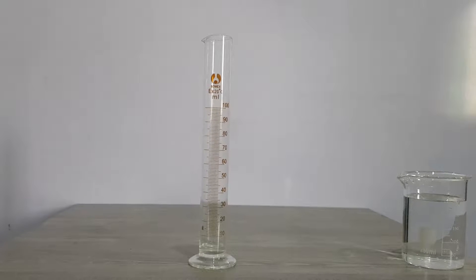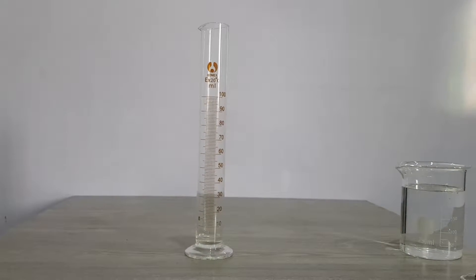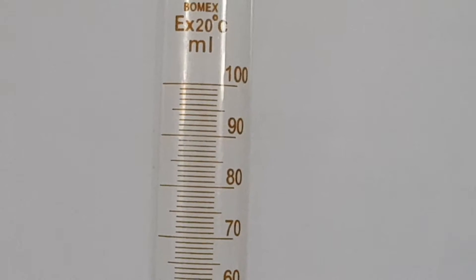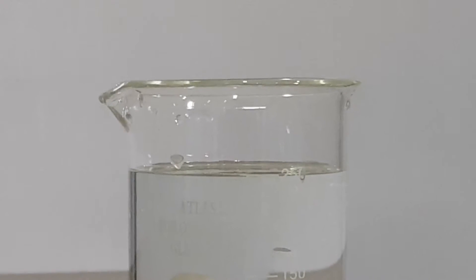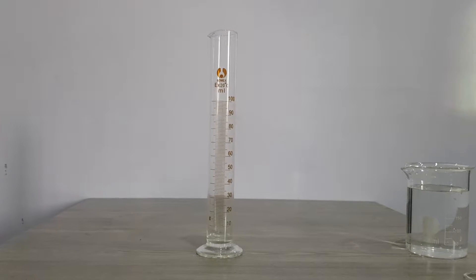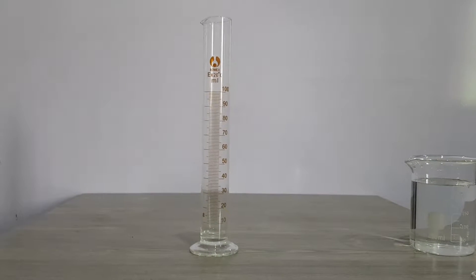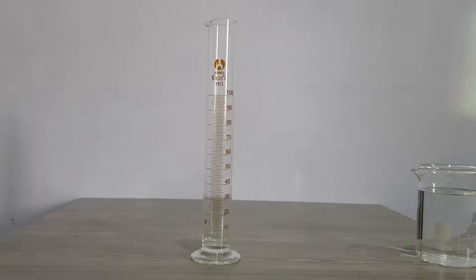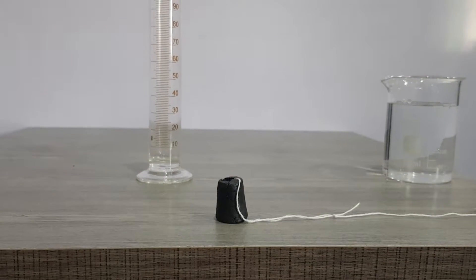It is used to measure the volume — the volume of a liquid or the volume of a powdered substance. Suppose you have flour, you can measure its volume with the help of this cylinder. Similarly, you can measure the volume of water with this cylinder. Remember to call it a measuring cylinder.